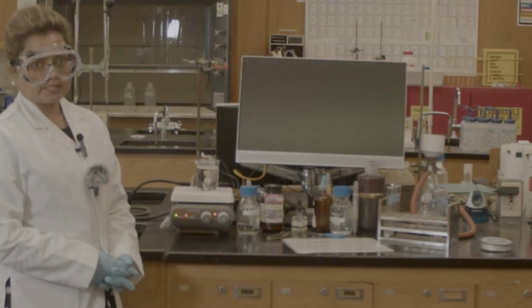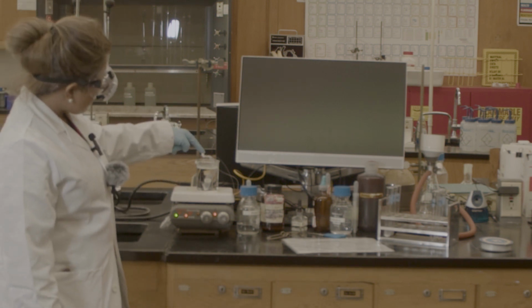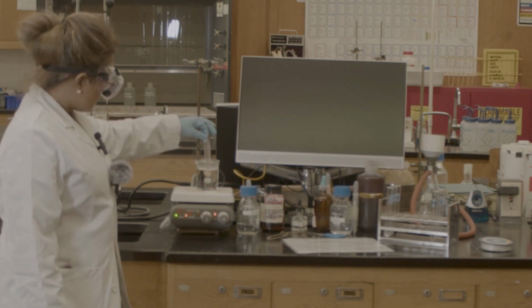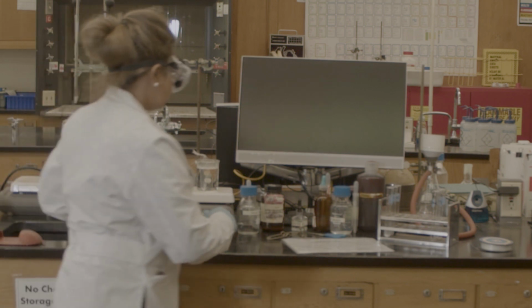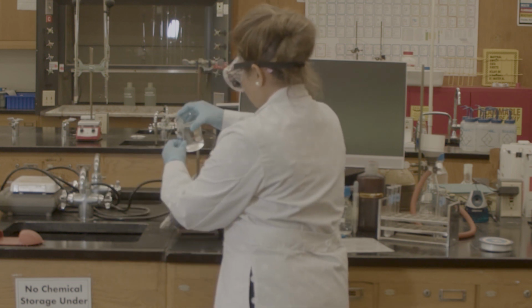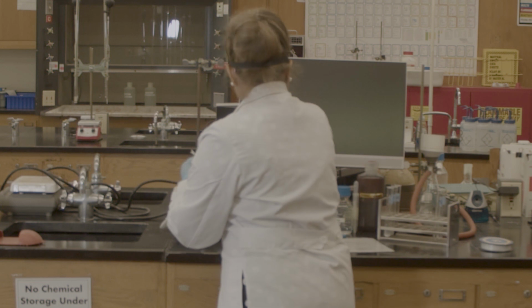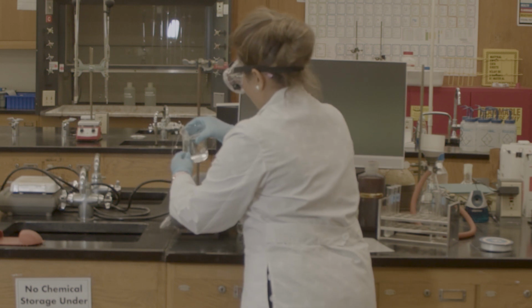So I came back after 30 minutes to do the hot bath. So now I will check which compound has passed through this semi-permeable membrane, the dialysis bag, from the dialysis bag to inside this jar. Okay. So I will take some solutions. I will do the three experiments again for barium, chloride, and for the starch.